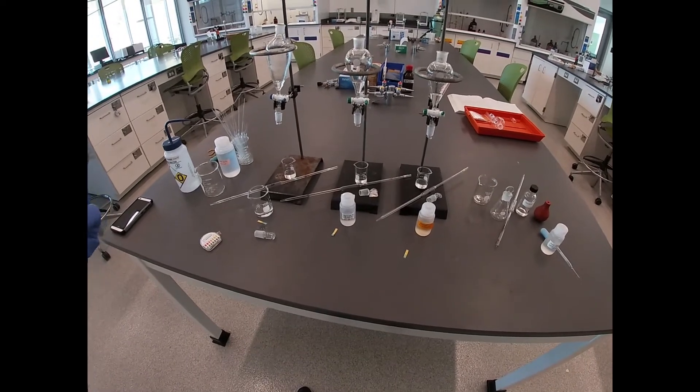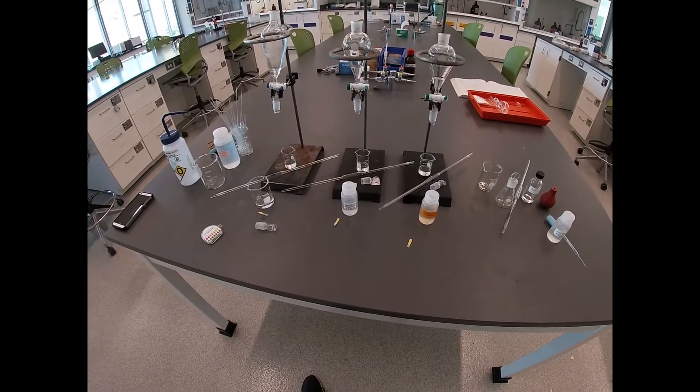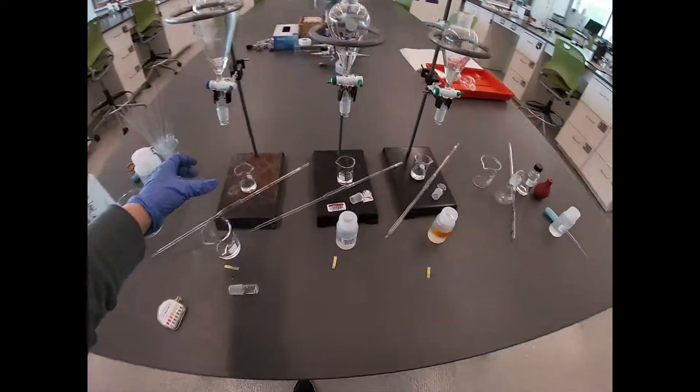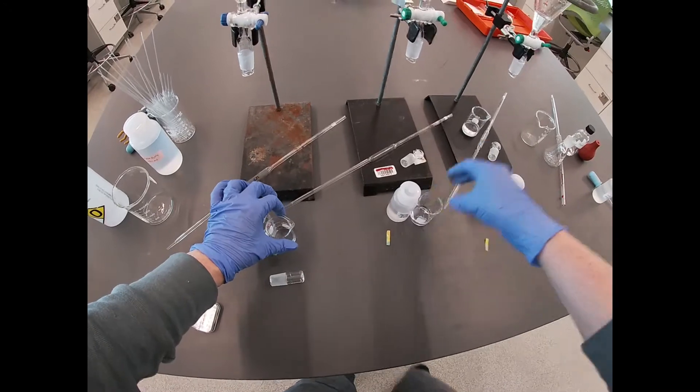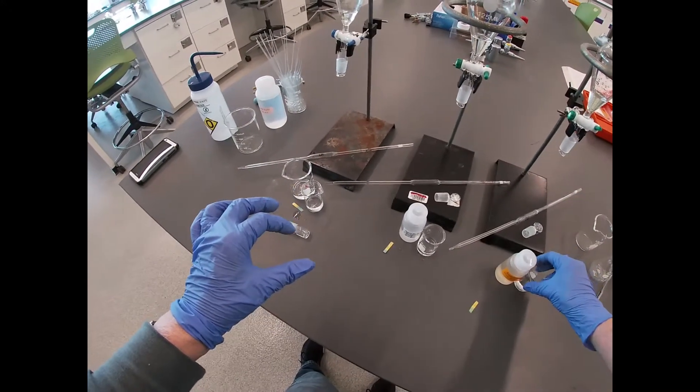So we need to extract back into 0.05 molar sulfuric acid. And ideally, we'll put these right next to their samples so we can keep them straight.